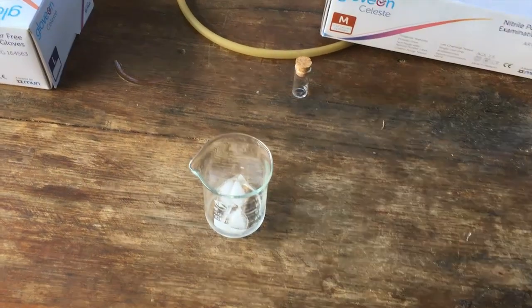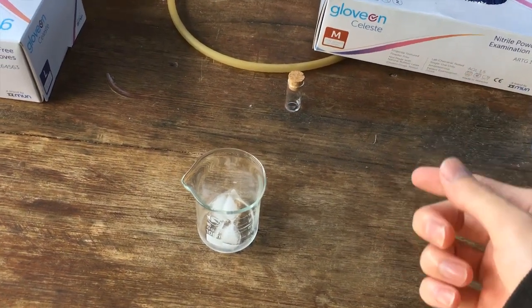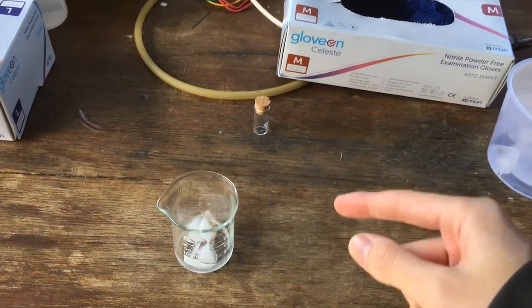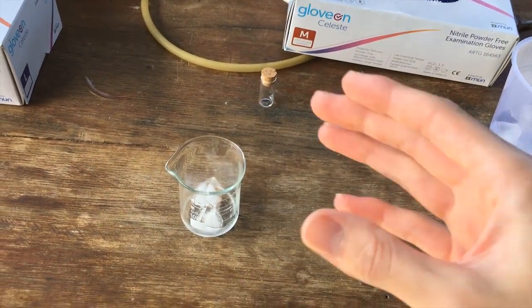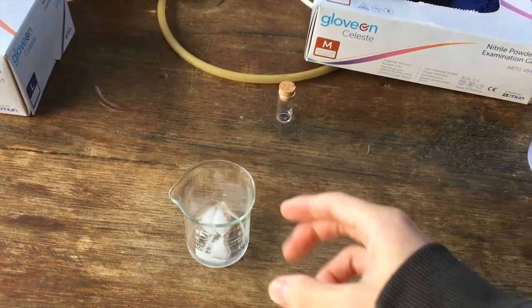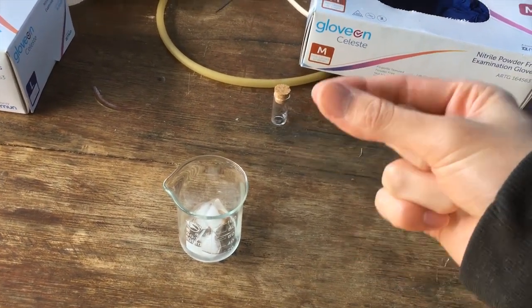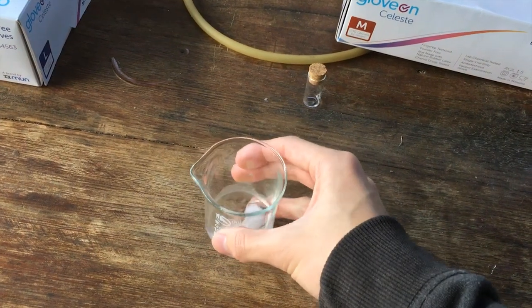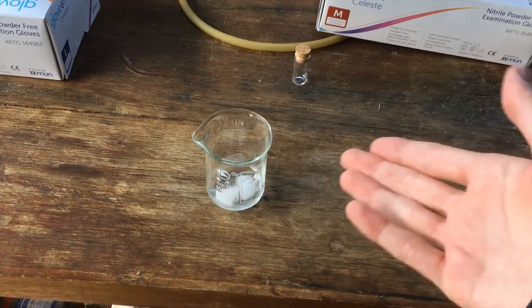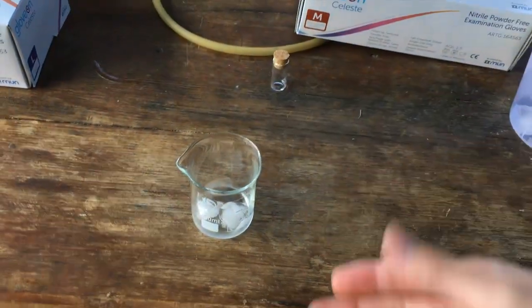The first test to determine whether or not we have heavy water is based on melting point. Because the melting point of heavy water is slightly above that of normal water, something like 4 degrees Celsius, I think. Anyway, we can check this. I don't know if you've seen the experiment where you get a test tube of benzene and put it in some ice cold water, which should be at 0 degrees. Benzene has a melting point of, I think, 5 degrees.